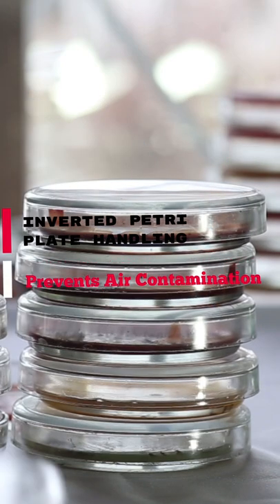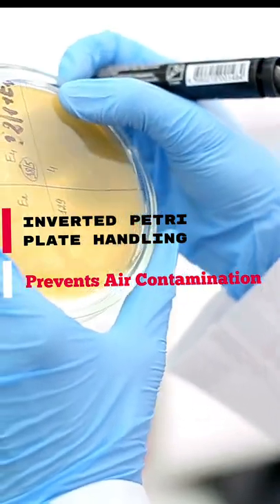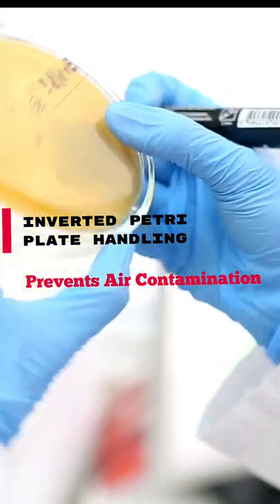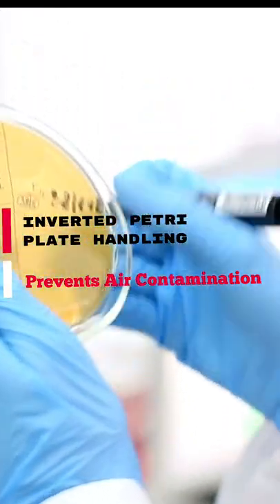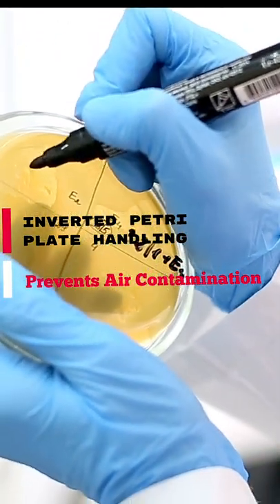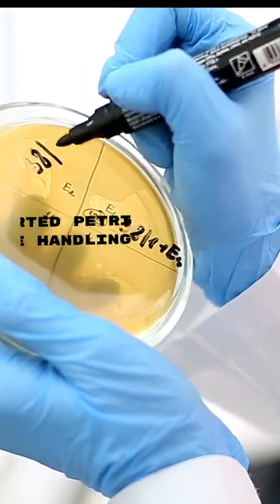It is easy to handle inverted petri dishes because the lid of the petri dish may open during handling when incubated in a normal position, and it may cause contamination from air.